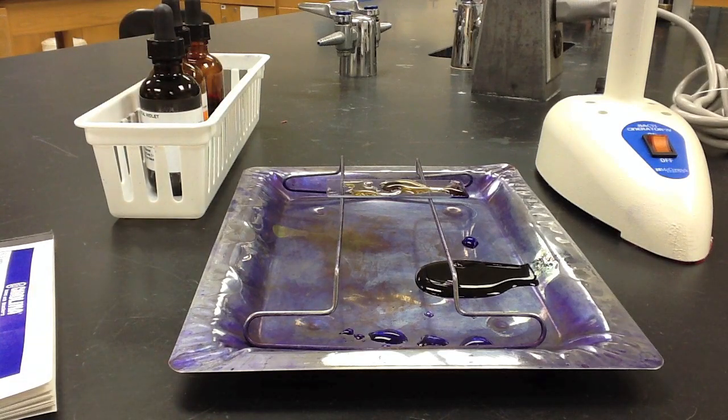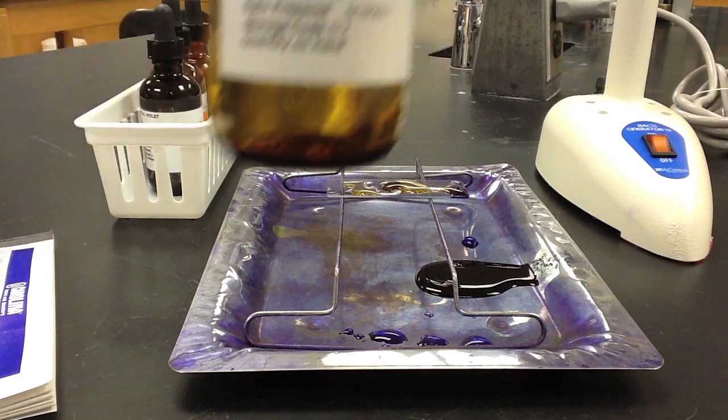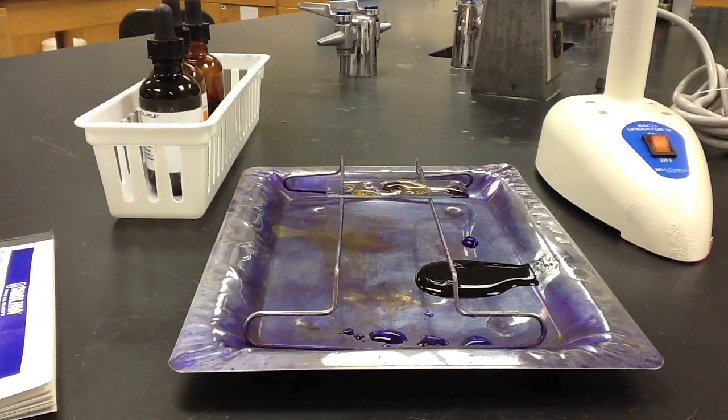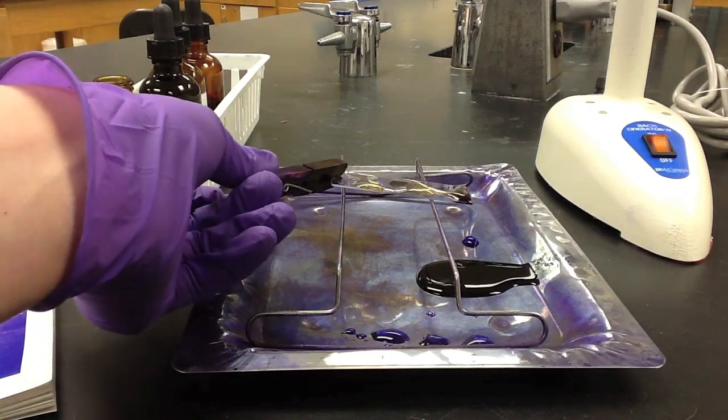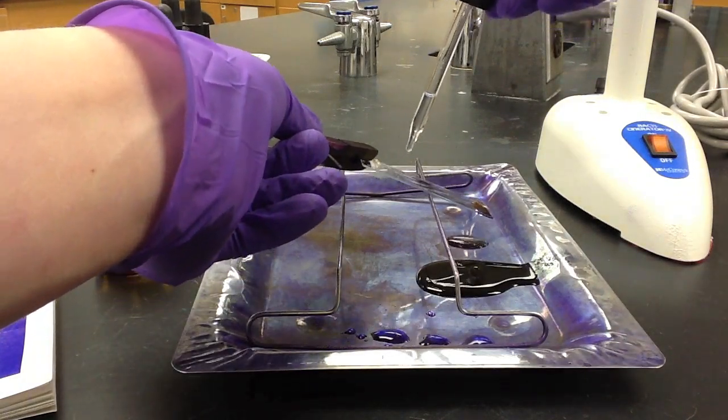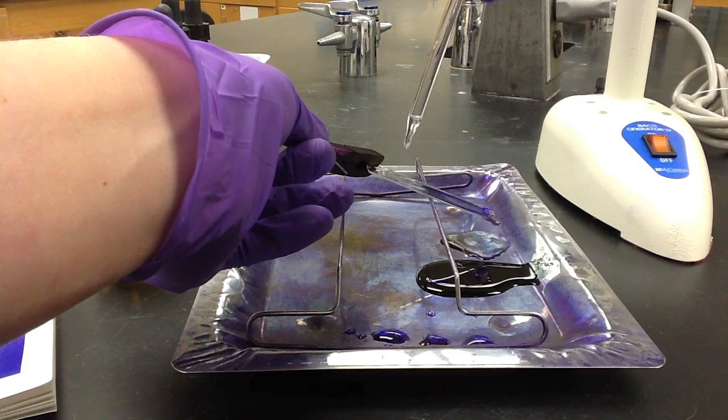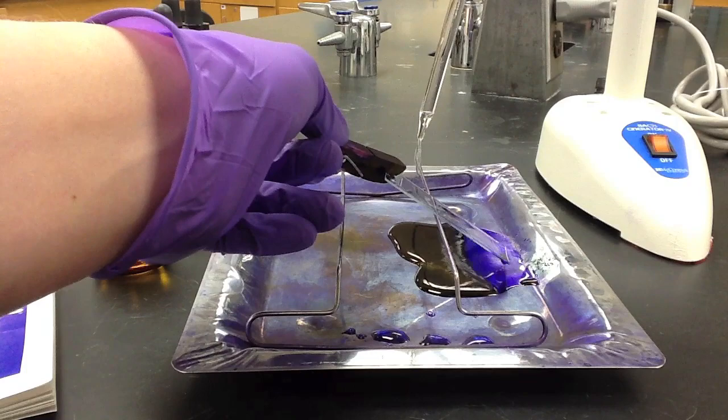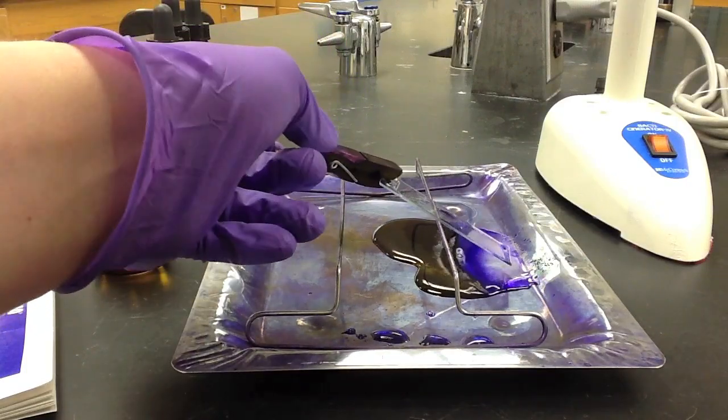At the end of the incubation period, we will then rinse the slide with decolorizer, which is ethyl alcohol. We'll do this until the ethyl alcohol runs clean, and then we'll immediately treat the surface of the slide with water.